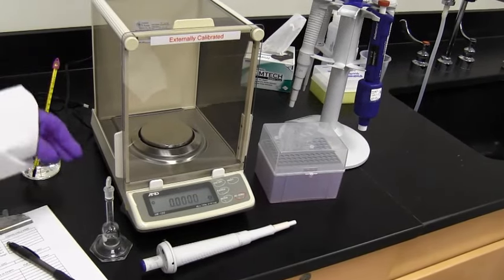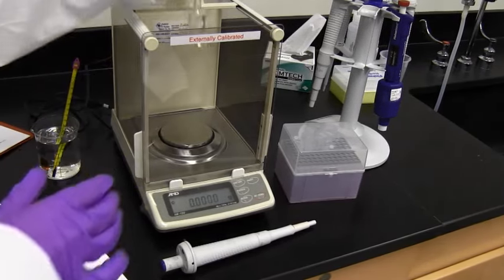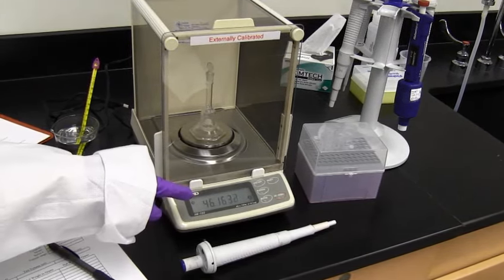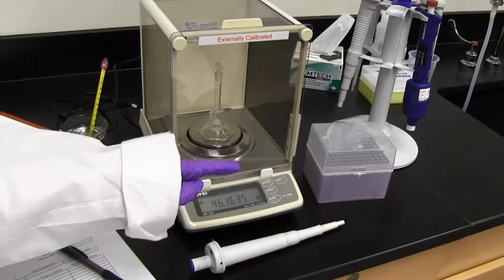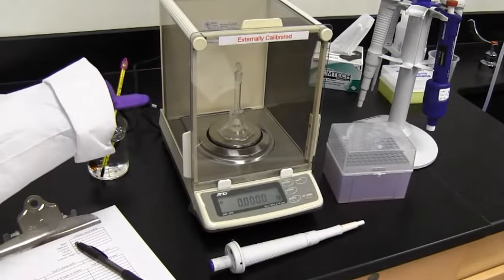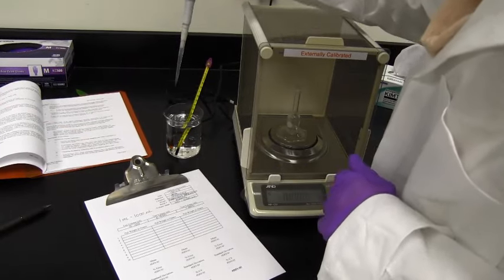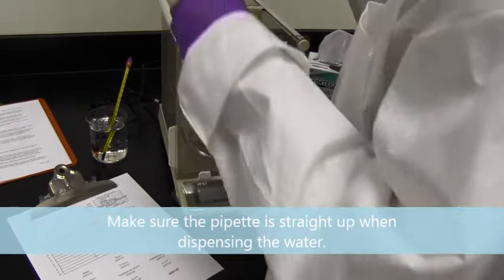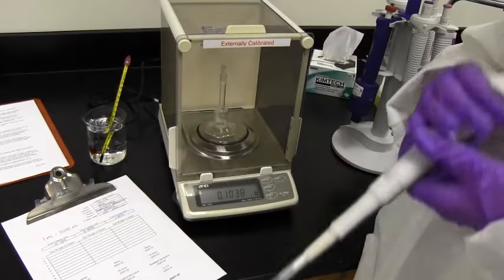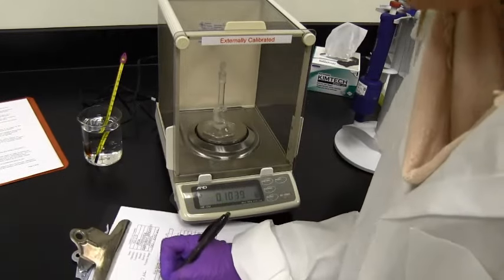So we're starting out with our calibrated balance. And the first thing we're going to do is put our volumetric flask in here. We open it up and put it in like this. As you can see, there's a weight that's showing on here. We actually want to zero this and make it zero. So it will start weighing the water inside and we don't want the volume of the flask to show. So we'll zero this and it will show as zero weight. And that's where we need to start from. So we're going to take our first volume, which is 100 microliters. And we're going to put it in our volumetric flask. So I'll put it in here. Close it. And we will record this value here, which is 0.1039 grams. And we'll put that right over here in our first column.